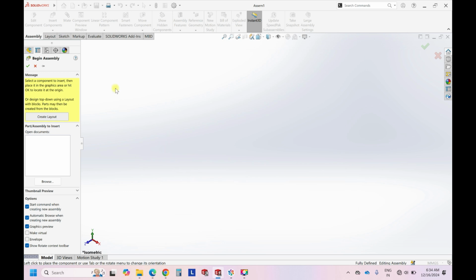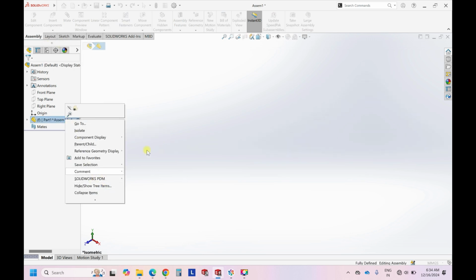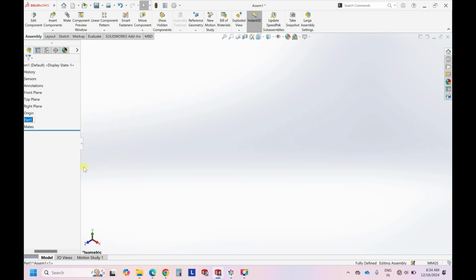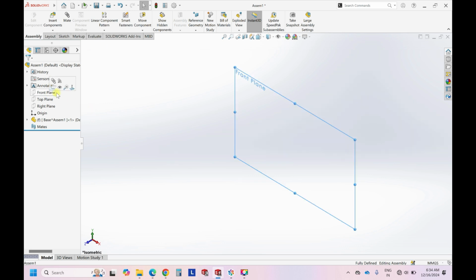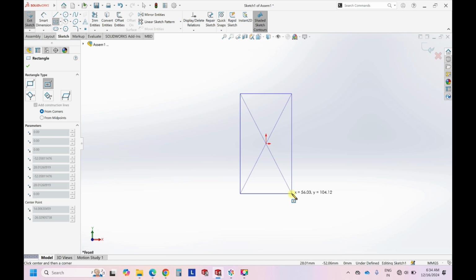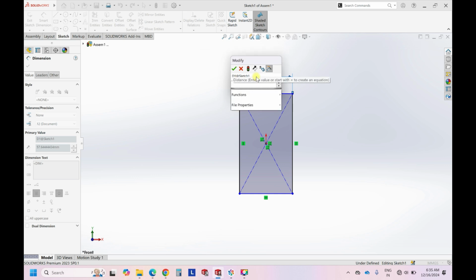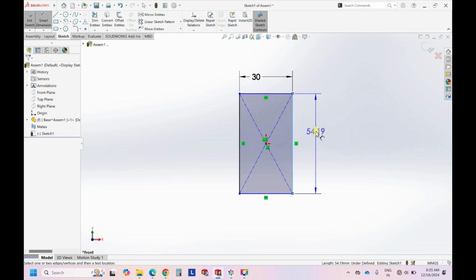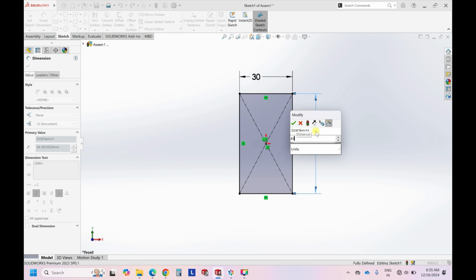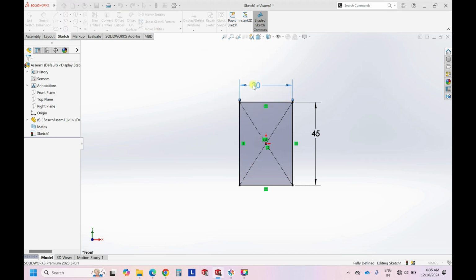Okay, so let's begin. We can insert a new part, and rename it as first base. Let's select the front plane. Whatever dimensions I take are just for reference purposes, because I'm not going deep into the paper, I'm not copying the paper. It is just for educational purposes, so I just take arbitrary dimensions. Let's consider this as, let's say, 30 mm, and this can be our regular 40, or we can increase it to 45 mm. Let's increase it to 25.